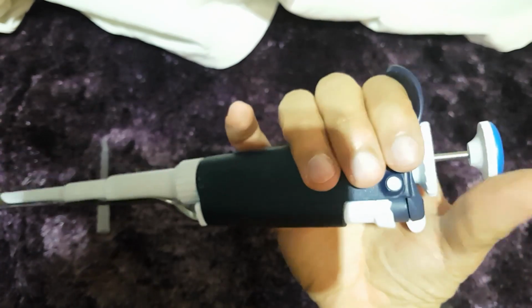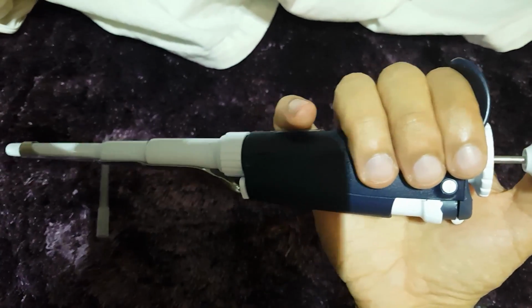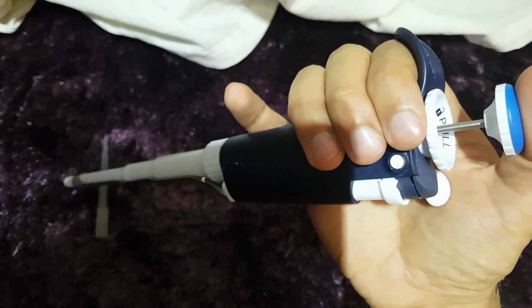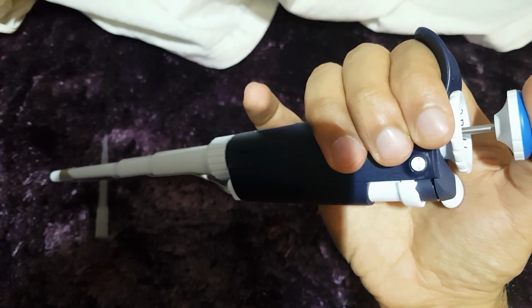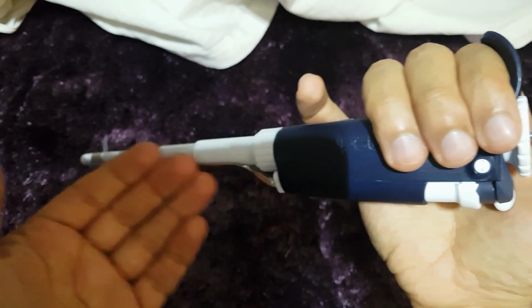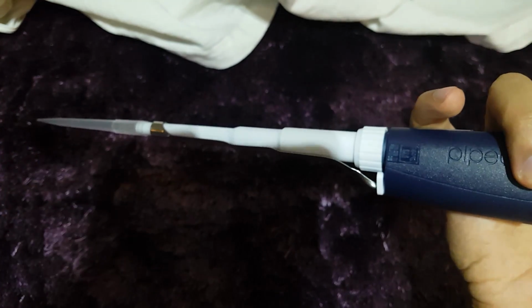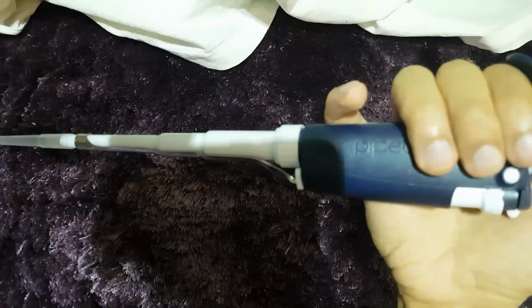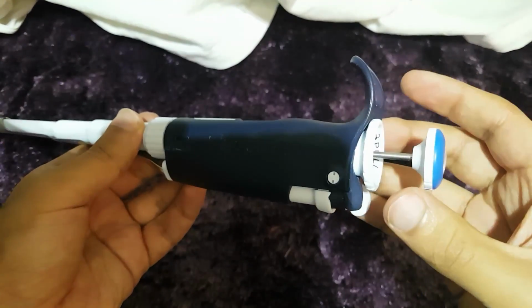So, how do we use it? You simply go up to the flask or wherever you're taking the liquid out of. You push down the plunger until it clicks once, and you pull it back up again slowly. Then, in your tip, you will have a volume of 750 microliters. I will show you this later on in this video. So, let's get to it quickly.